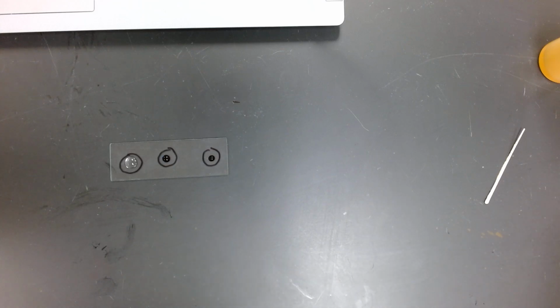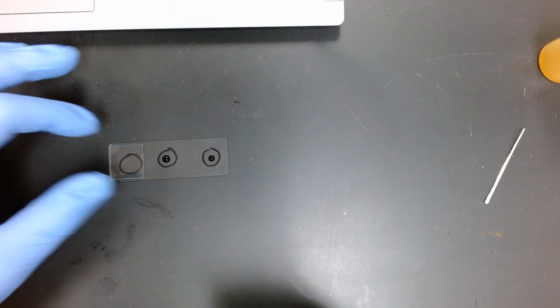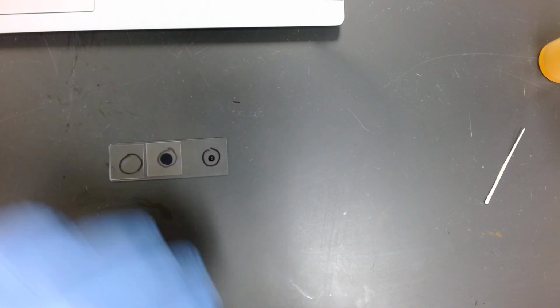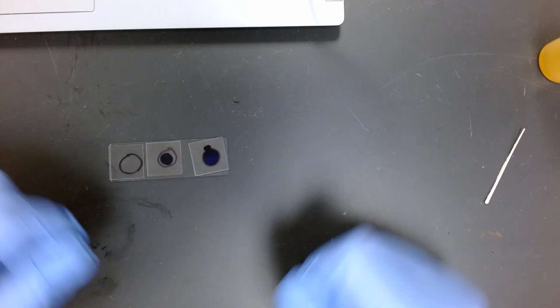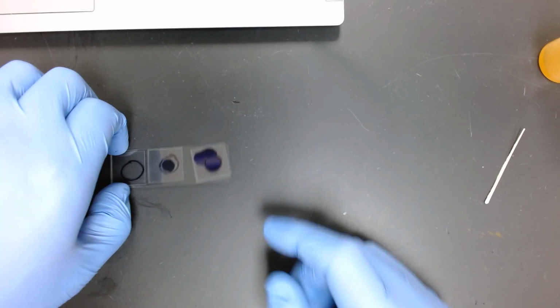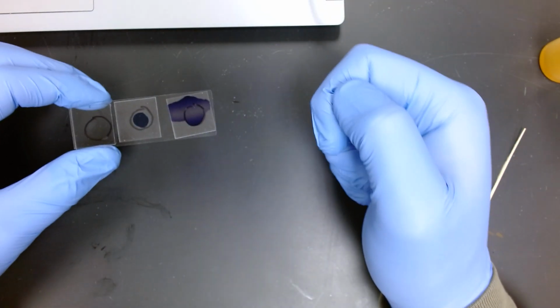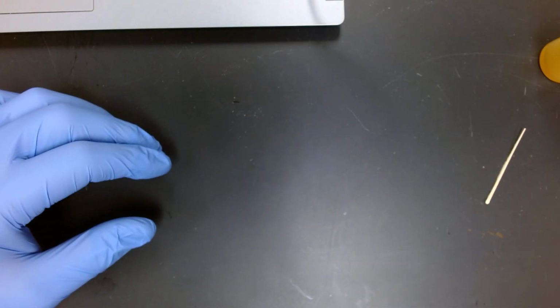We're just making a wet mount, so then we'll come over and we will drop our cover slips on. We'll drop those down at a 45-degree angle. So this slide is ready for the microscope, in which we would try to study our cheek cells. We'll make one of these slides for cheek cells, onion cells, and celery cells. And we will be cutting samples from those on our own.